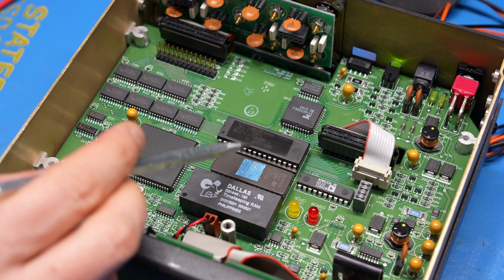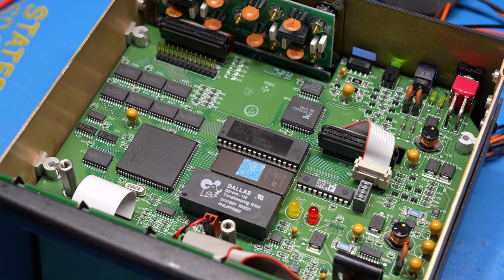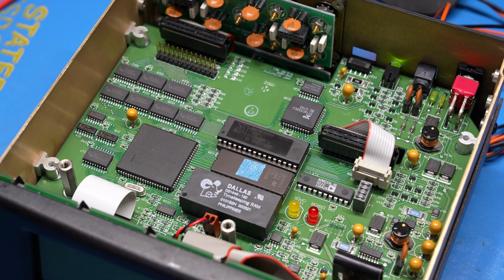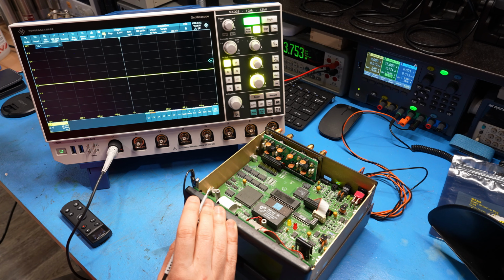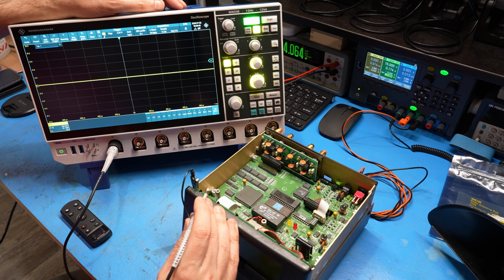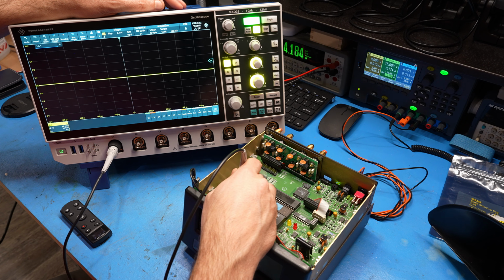So let's take a look and see if there is any activity, because if this thing is running in the background, there should be communication between all of these components that are all connected together. If we do see something, of course, there's a clock as well. And if those are all working, then we can dig in a little bit deeper. Here, I'm going to use the Rohde & Schwarz MXO 38, which I've done a complete teardown and review of very recently on the channel. Definitely check it out if you want to see how it works. So let's try the power supply of the microprocessor first.